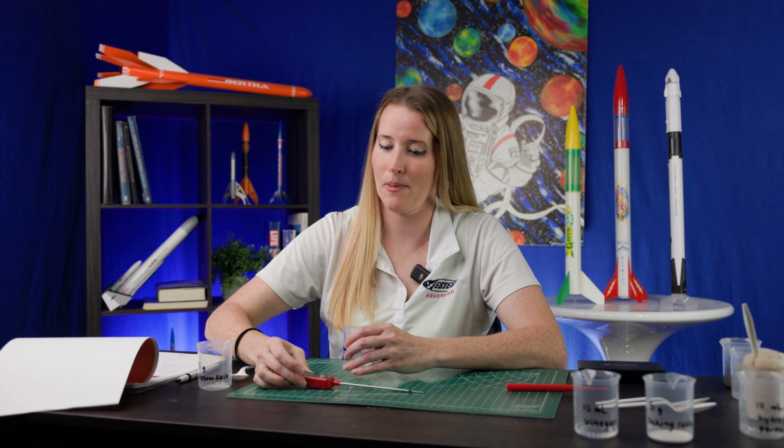All right, next you're gonna wait 1 minute. It's been 1 minute, let's check. We have 18 degrees Celsius. So that was a decrease of 4.2 degrees Celsius.